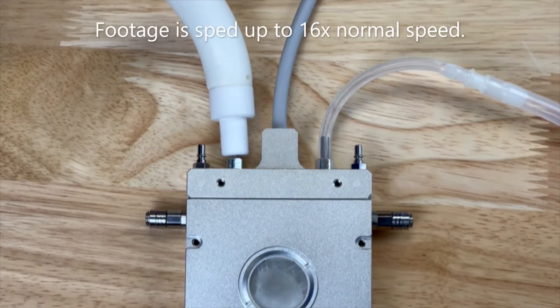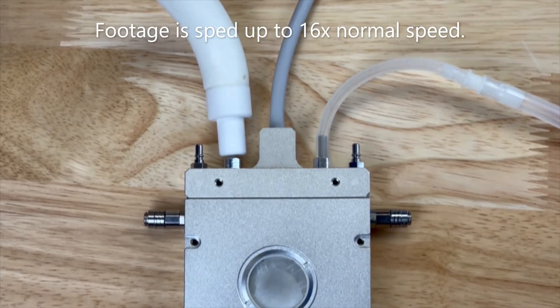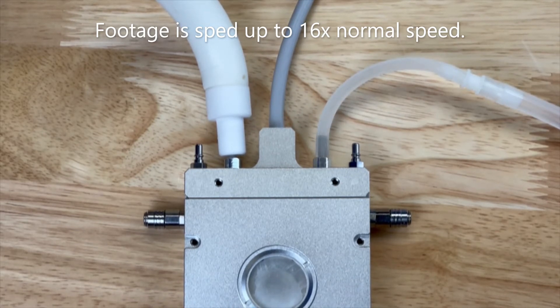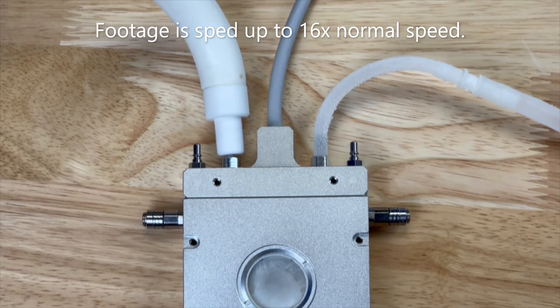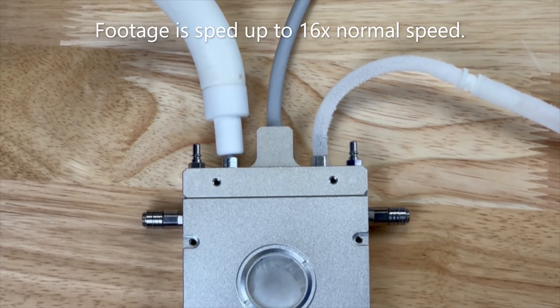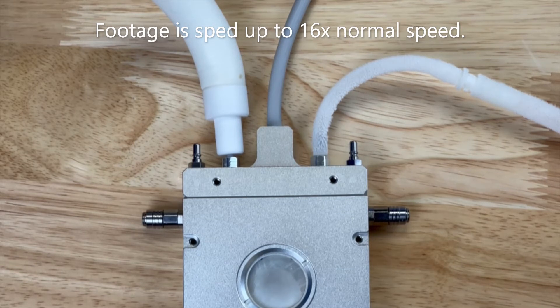To prevent ice formation on your sample at low temperatures, you can purge an inert gas or pull a vacuum on any compatible closed chambered INSTEC stage. Ice formation on the outlet tubing is normal and typically harmless. Adding foam insulation may reduce some condensation.